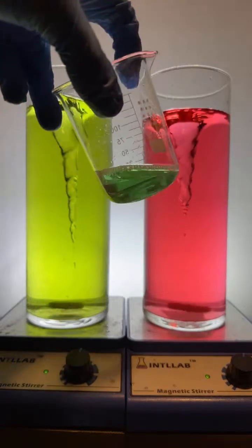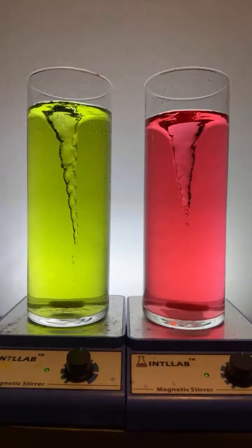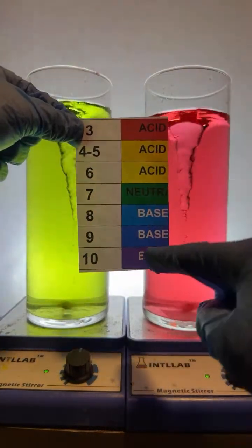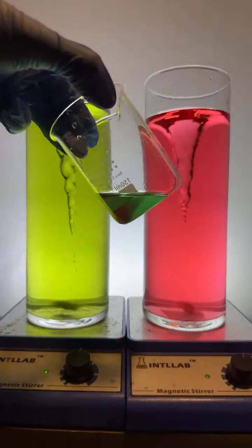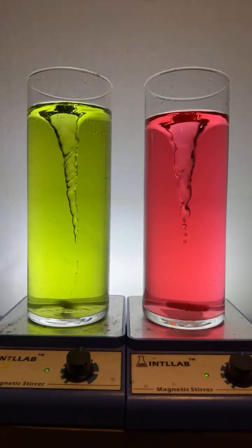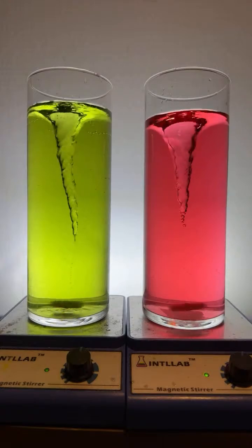So they neutralize each other, right? Let me show you. I took some fluid at pH 3, and I took some fluid at pH 10. I mixed them together, and they neutralized each other. They gave me a green fluid. Great question. And that's a fun experiment to do. What other questions? Let's see what else. Can I make it... I thought it would make it yellow.